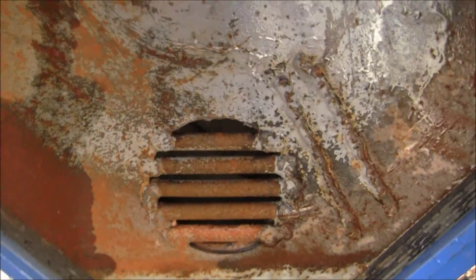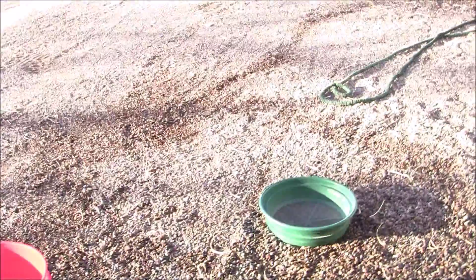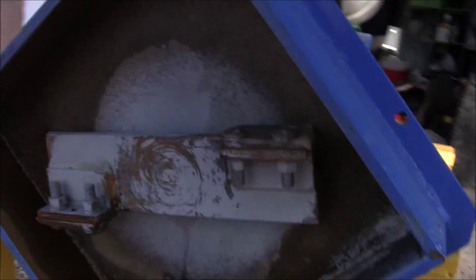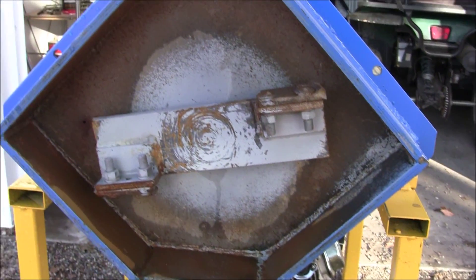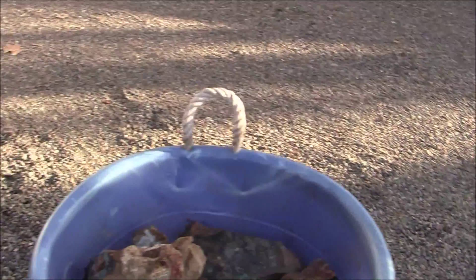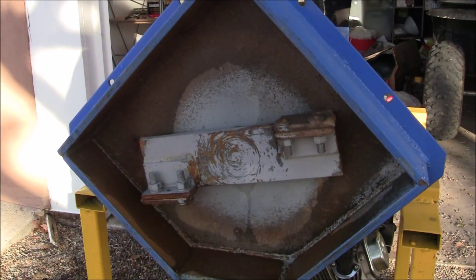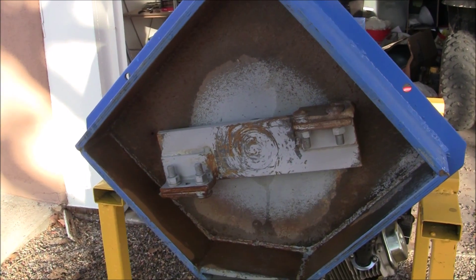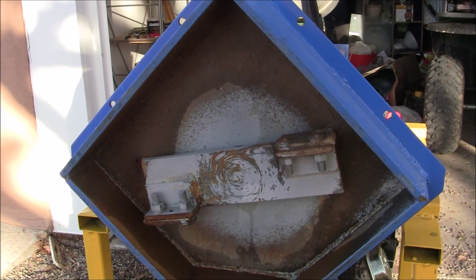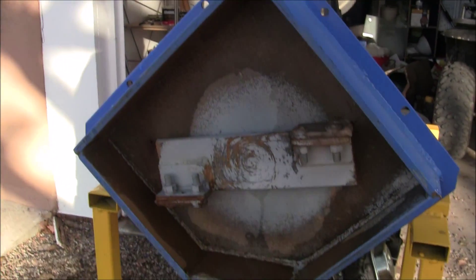And they go out that hole right there. I wish the openings on that were quite a bit smaller because it does let some larger pieces through. For the most part you get about 80 to 85 percent of that bucket turned into 100 to 200 mesh powder. And I'm going to have to rerun the rest of the stuff so that I have a nice consistent product to put on the table and to do some testing.